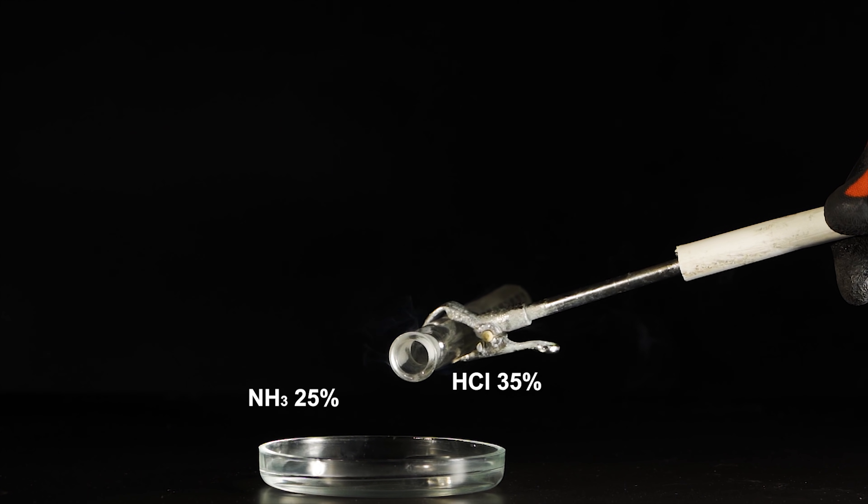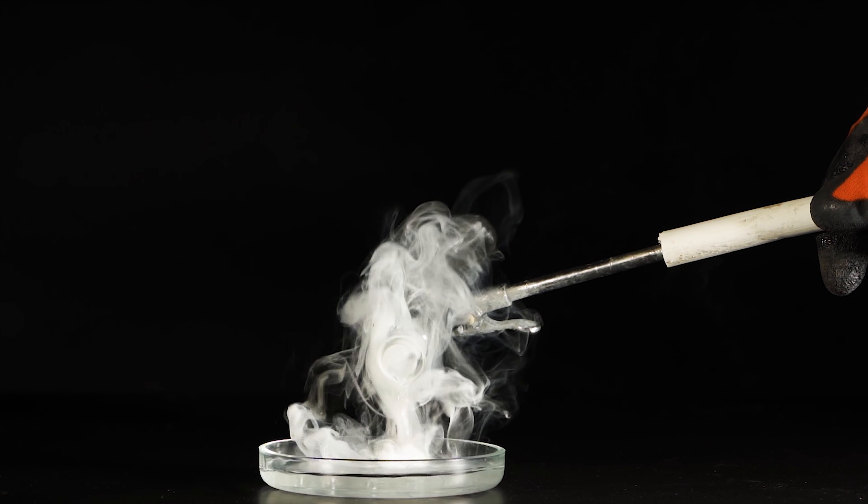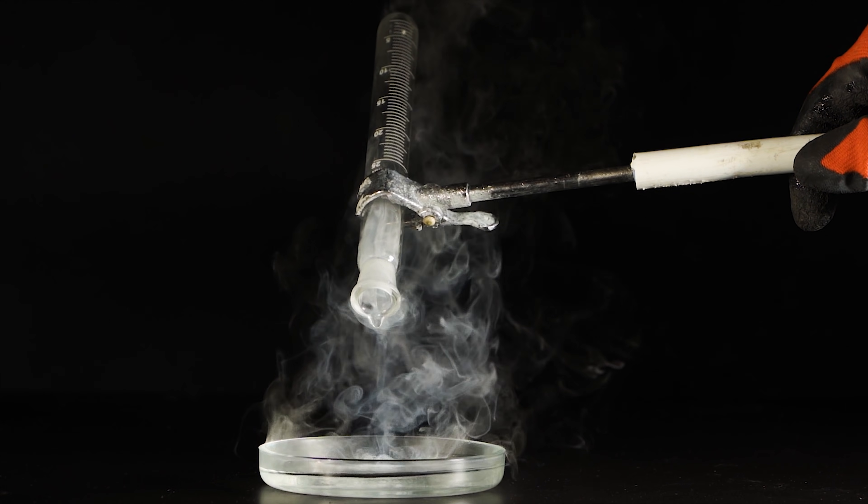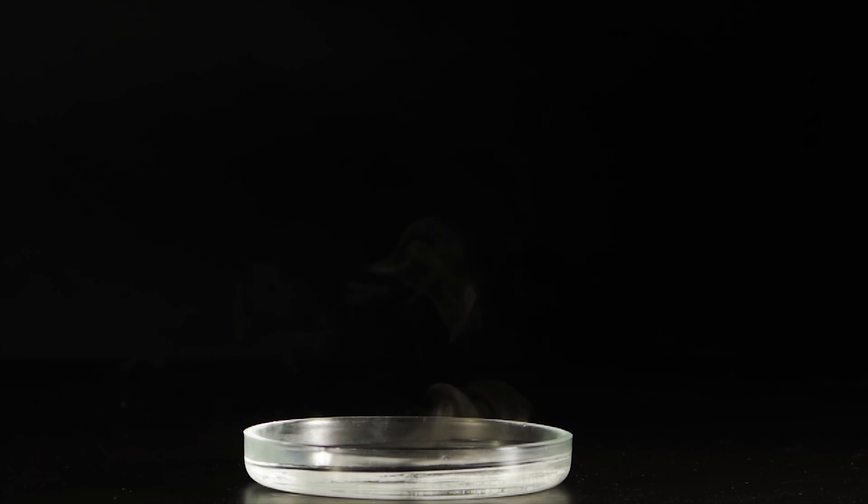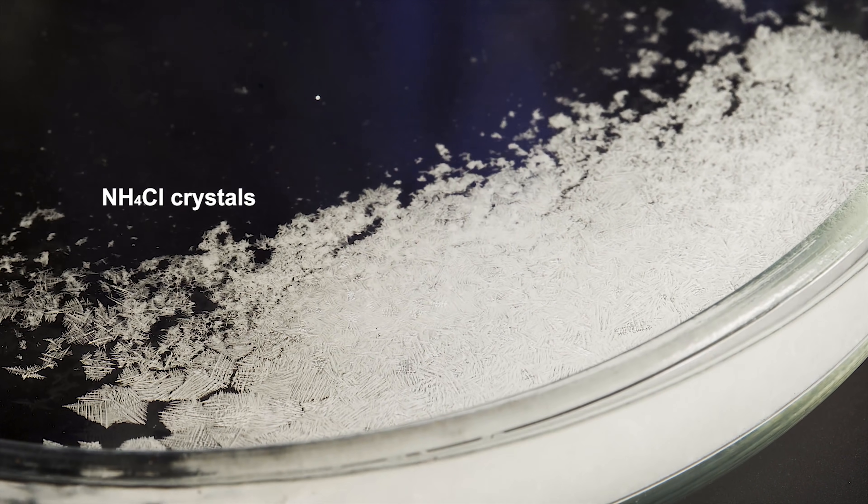For starters, here's the reaction of regular concentrated ammonia solution and hydrochloric acid. Not impressive at all, right? Although some beautiful crystals of ammonium chloride did form on the bottom of the petri dish.